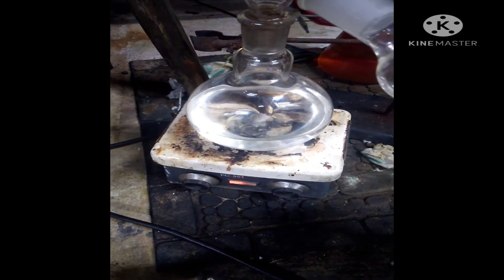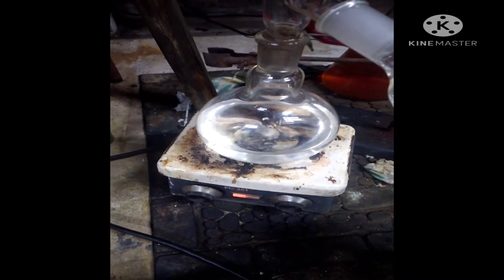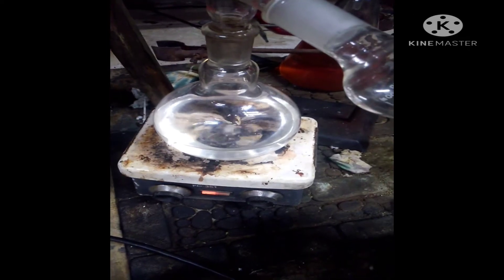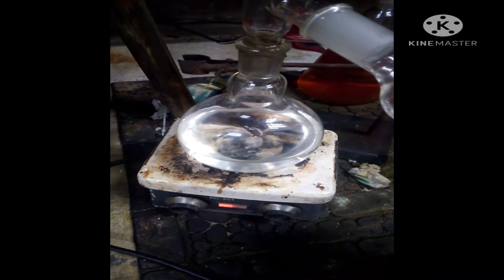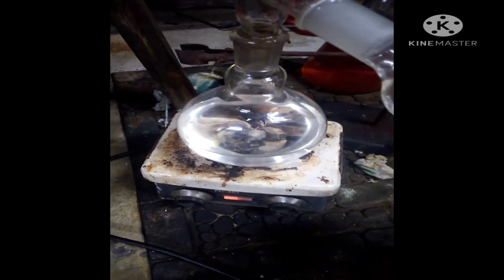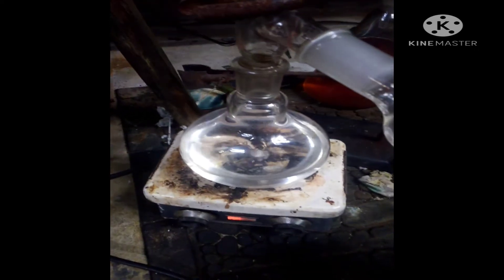All my sulfuric acid is added and now I'm going to set this into a gentle reflux. I'm going to monitor the temperature to keep it around 90 degrees Celsius so it doesn't go out of control — because you can end up superheating it and it can end up jetting out of your flasks.